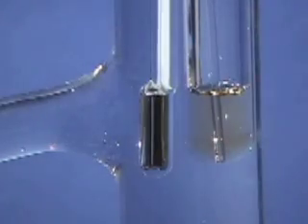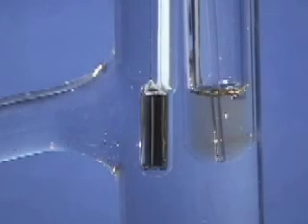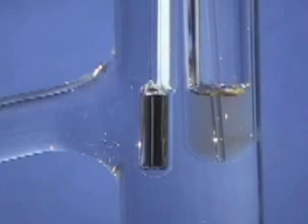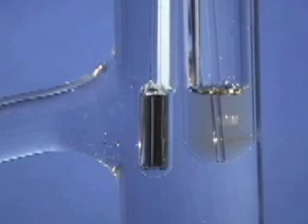Heating is continued until a rapid and constant stream of bubbles is observed. This occurs at the boiling point, when the vapor pressure of the liquid exceeds atmospheric pressure, and gaseous sample forms on the surface of the mouth of the capillary. At this point, heating may be stopped.